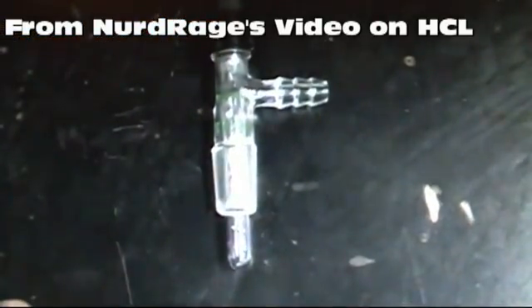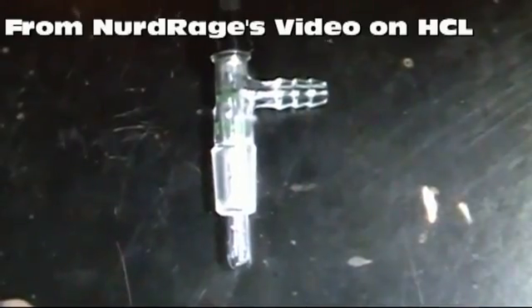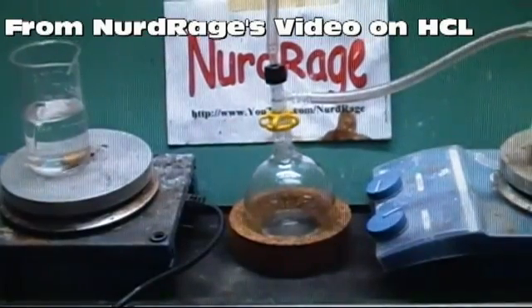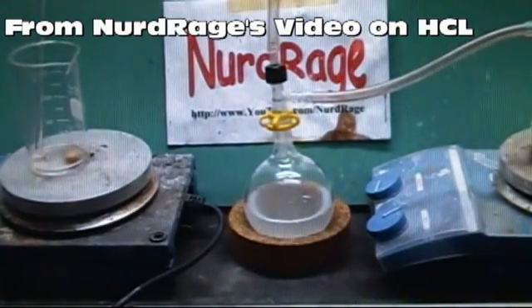This backflow problem is common and several people have contacted me asking for a video on how to prevent it without having to buy the adapter. So I decided to do a short video on just that using common lab items.